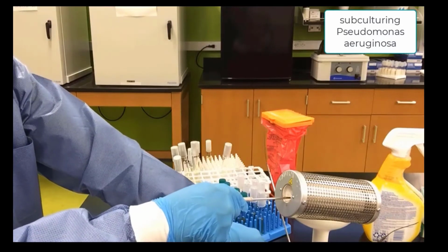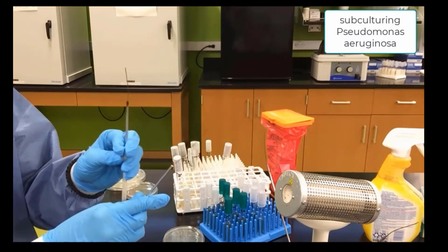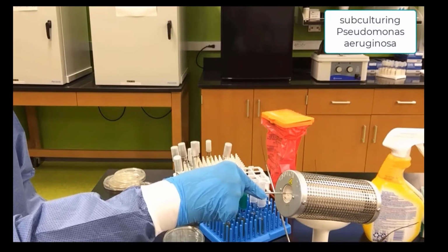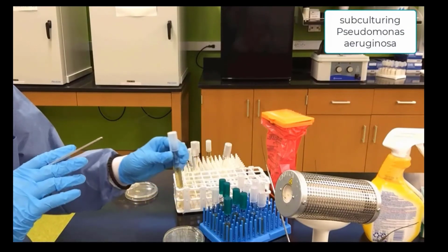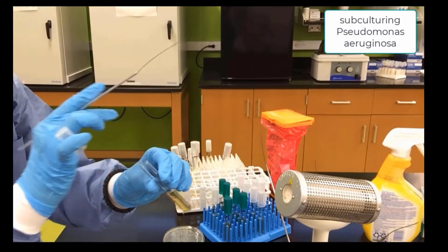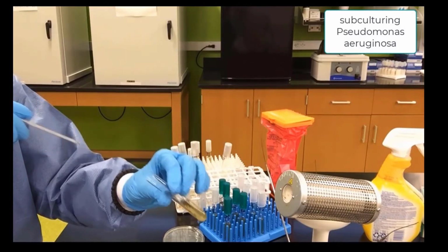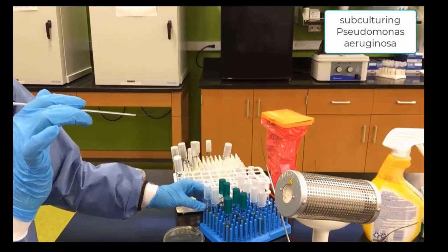We sterilize our needle. And again, if you'd like to go a little faster, you want to sterilize a couple needles and have them ready. So now we are ready, after the needle cools, to pick up some more Pseudomonas aeruginosa from the original culture. Very careful not to let the white cap touch anything because then we can get contamination introduced. We go to the bottom and we pick up bacteria. Now some people think we didn't pick up enough, but there's plenty of bacteria on that needle.